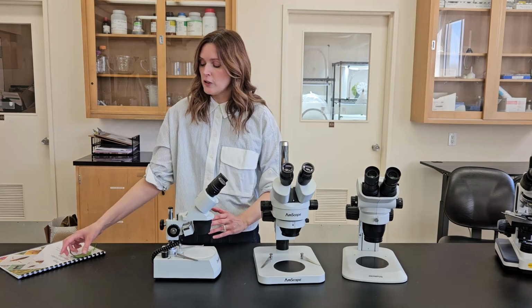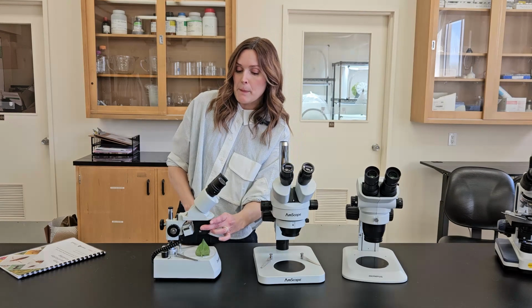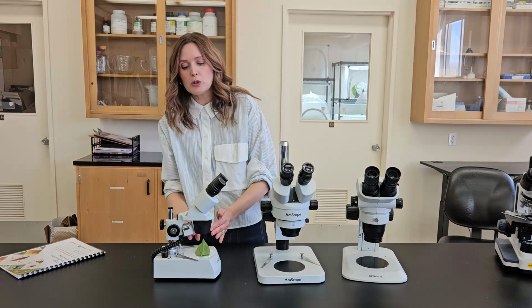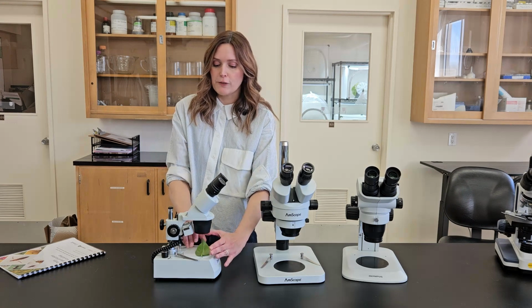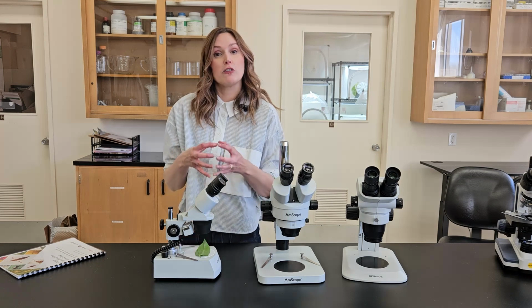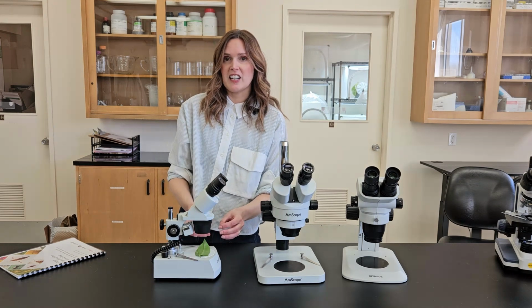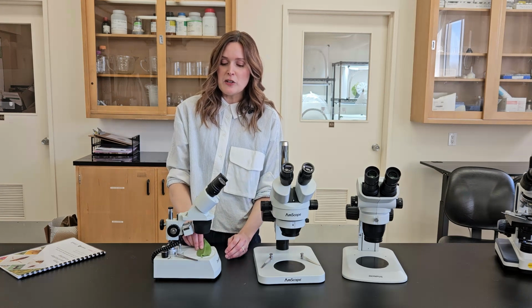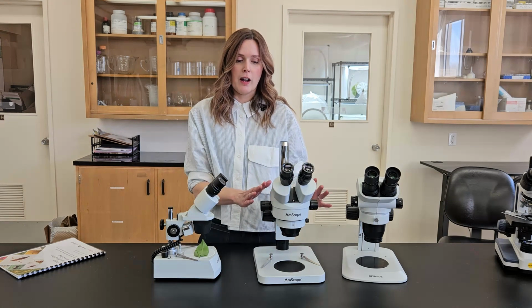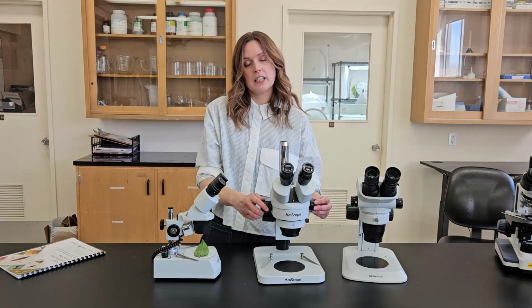The other thing is when you've got a specimen positioned at 20 and then you snap it to 40, because that is such a large jump in magnification, sometimes you can lose where your specimen is in front of you on the leaf when you're just looking through the eyepieces, because your focal point that you're looking at is much smaller than if I'm just staring at this leaf without the microscope. So then you can spend some time being like, where'd it go? So just overall, this can be a more frustrating type of magnification zoom.